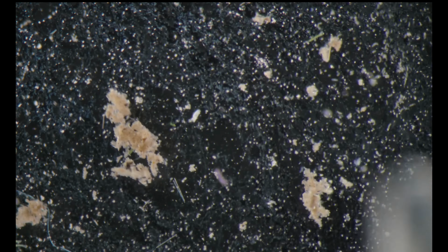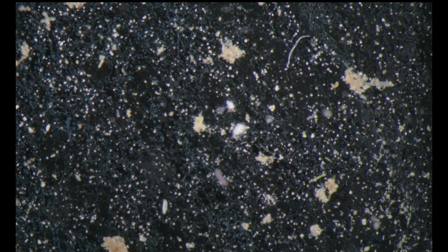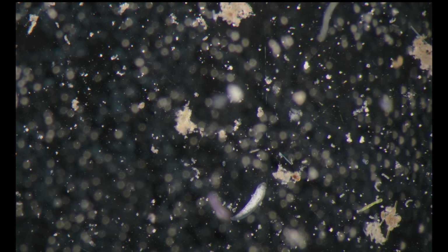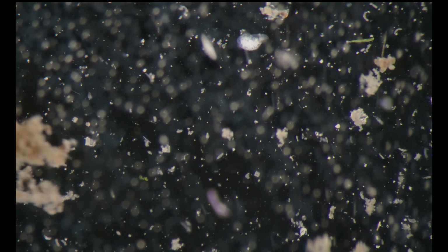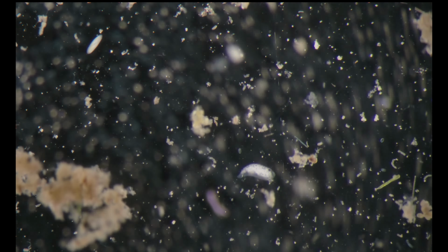Another useful technique you can do with specimens that like to attach to the substrate, I'll lower the luminosity, is use the micropipette as a pump. So the creatures that are attached will stay in place.